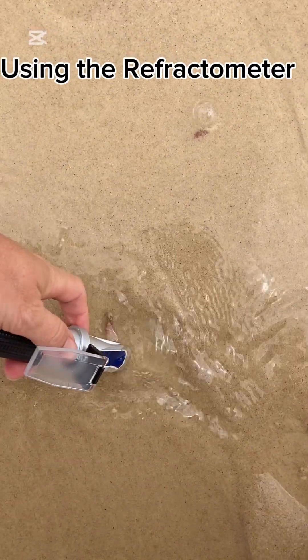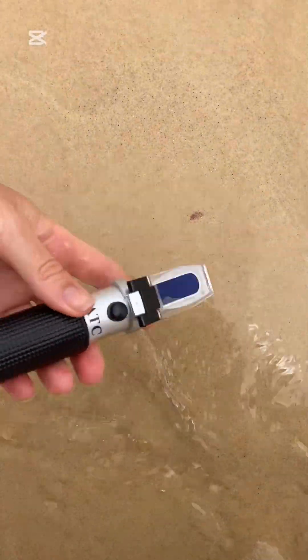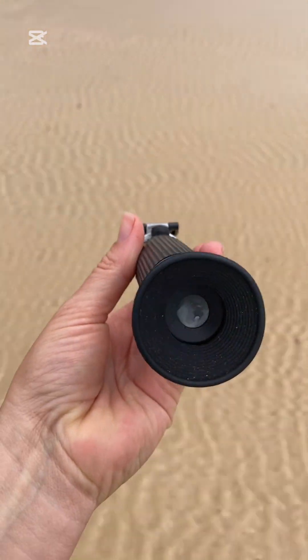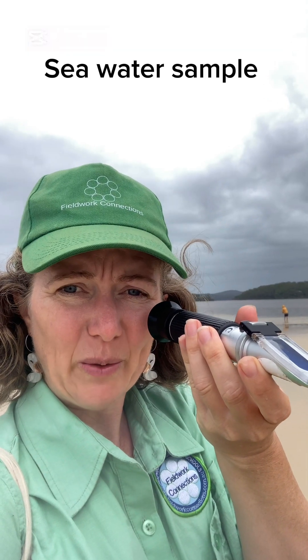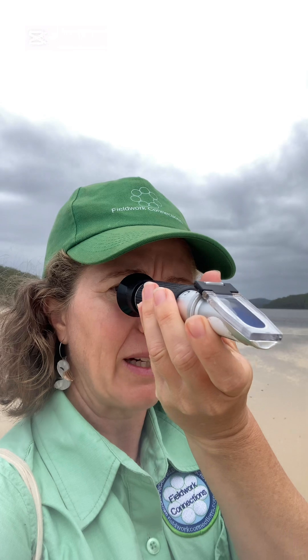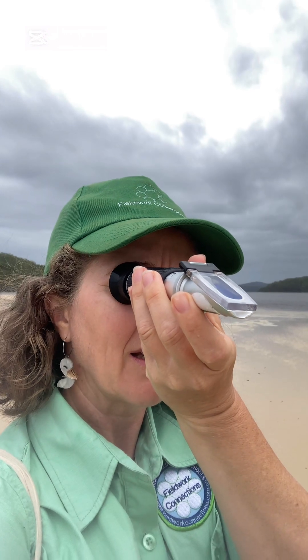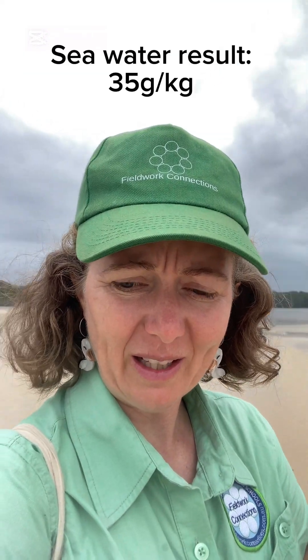I'm just going to try and collect a sample of the salt water coming from the ocean. I've got my sample of salt water on the plate and I'm just going to take a reading — it is reading 35 grams of salt per kilogram, just as we'd hoped for from the ocean water.